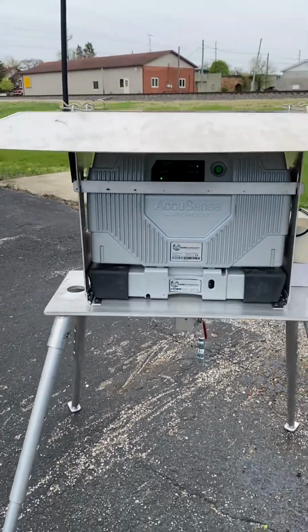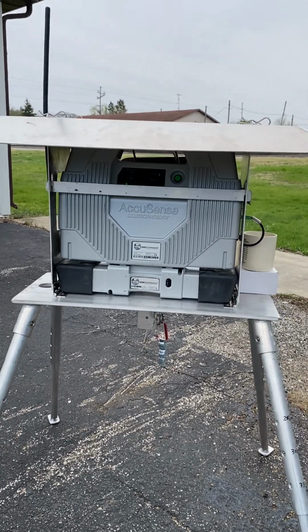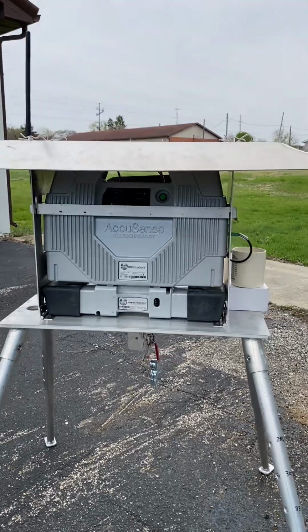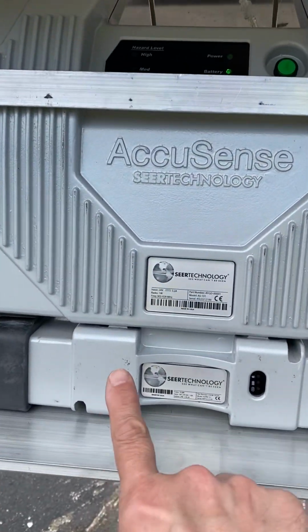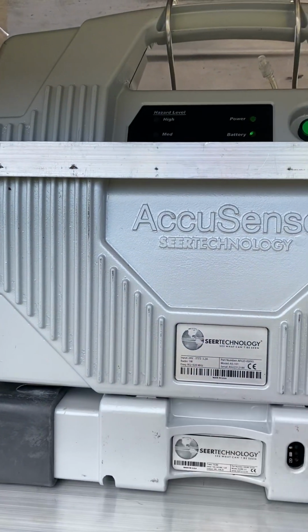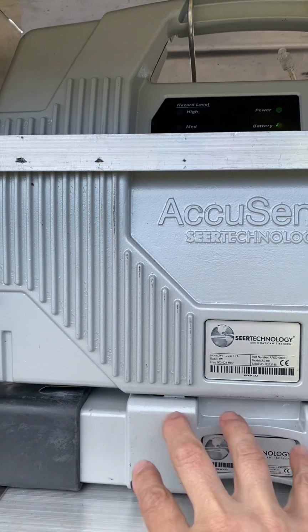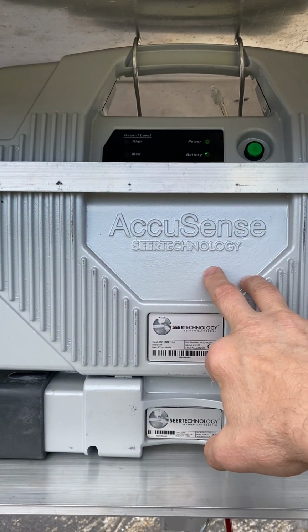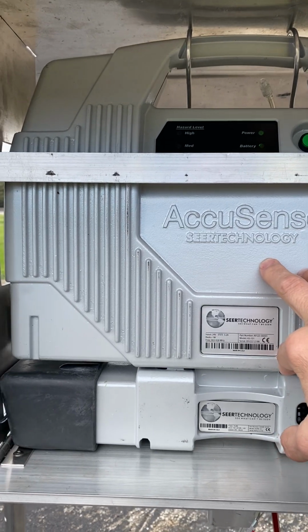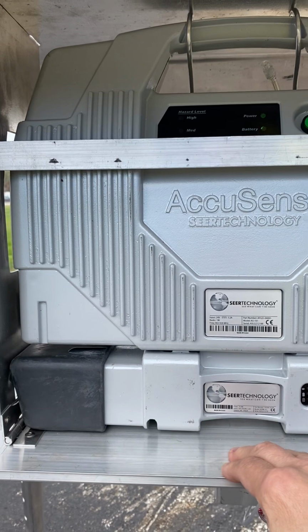Although you don't have to use the stand. The instrument is more than enough weather protected to just leave it out on its own, but you can definitely use the stand. Now, you'll see here too, we have the 2 battery packs. It's 2 sections here. So when we have it all connected, we have 8 hours of battery power in the bottom section battery, and then the internal battery inside the AccuSense has another capacity for 8 hours. So combined, like we have it here, we can go 16 hours on a charge.